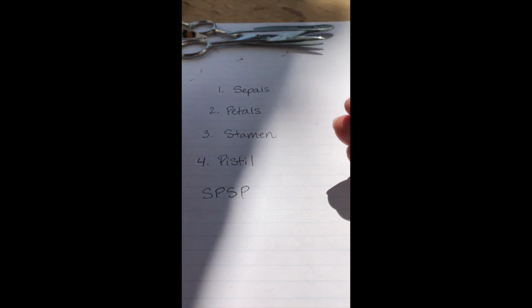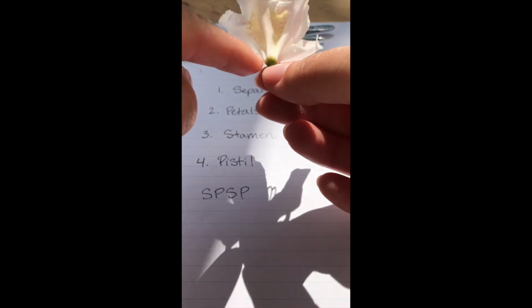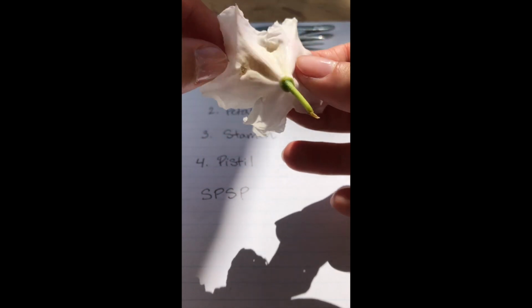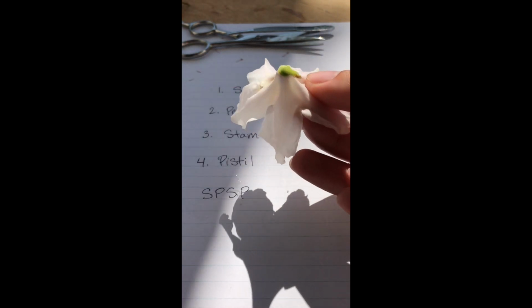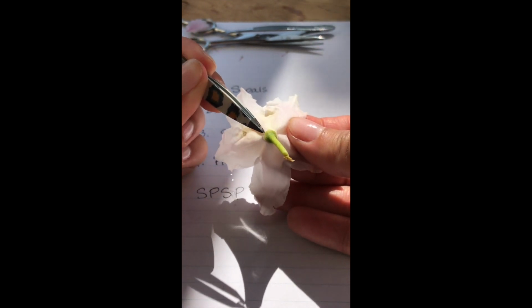So remember, if we're returning to our list of flower parts and we know that we're going to start with sepals, we expect that we're going to see those sepals sort of hugging the petals on the outside of the flower. But when you look at this flower, there's not a really obvious little leafy looking sepal that is hugging these petals. Remember, with the flowers that we dissected before, it was really obvious. These ones, the sepals were actually sort of pinkish color. But on this flower, it's really not very obvious. So on this flower, the sepal is actually just this little green cap-like part.